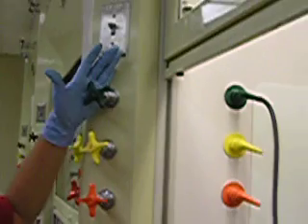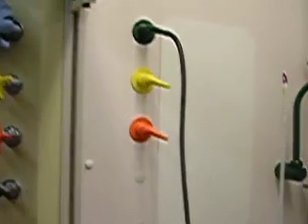And then we want to turn on our water from our cool water supply. We want to give it a firm turn, but we want to make sure that we don't turn the water on too fast, because water will go everywhere. Allow the water to fill the jacketed condenser so that we slightly see it flowing through, and we want to avoid as many bubbles as possible.